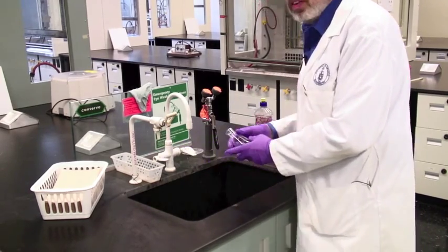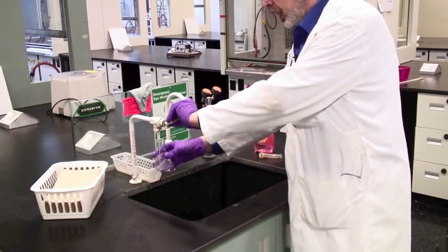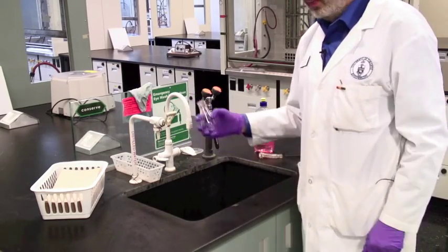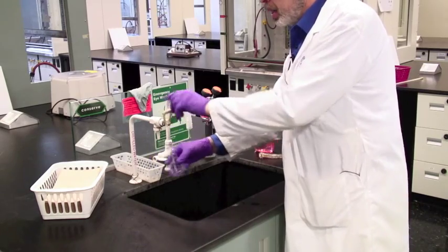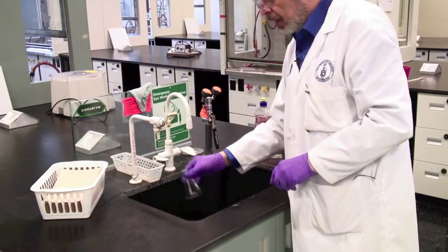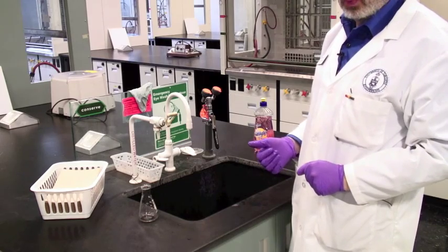You will need to rinse it with distilled water. That's this tap here. Don't leave the tap running like this, please. This is not to happen. This is coming from a tank somewhere. We need to make it, so use a minimum amount. Fill it, rinse it a couple of times, and that is now ready to go back into your locker. It will be dry by next week.